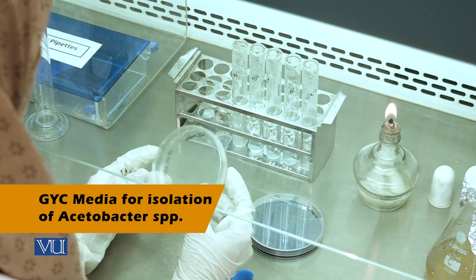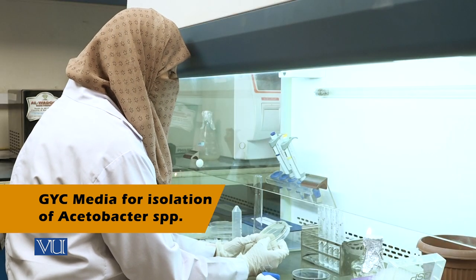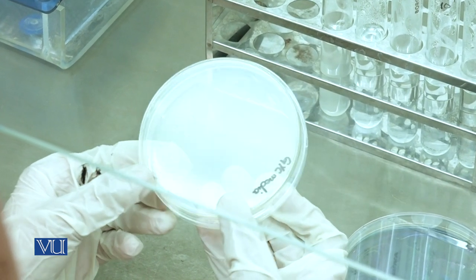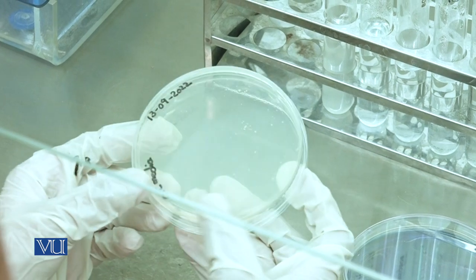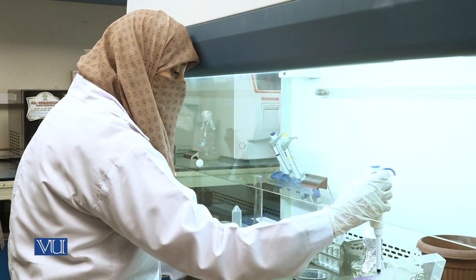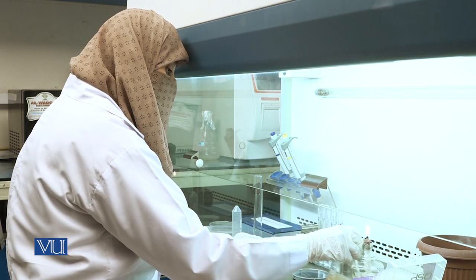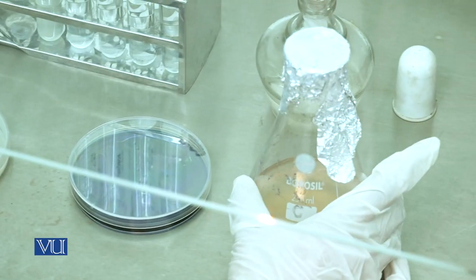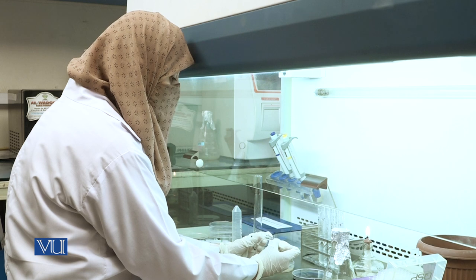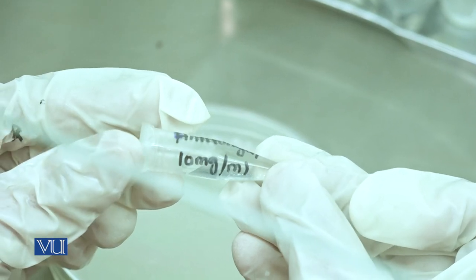Prepare GYC media for the inoculation of grape samples. This is an already prepared GYC media plate. After sterilization of media, add antibiotic. This solution is prepared by measuring according to a 10 mg per ml solution.